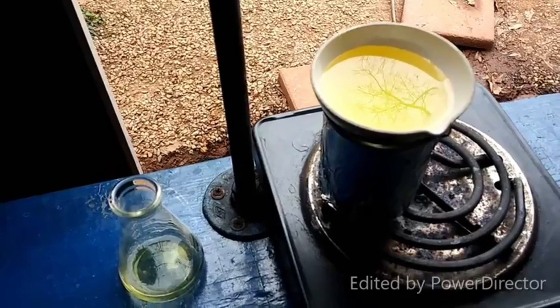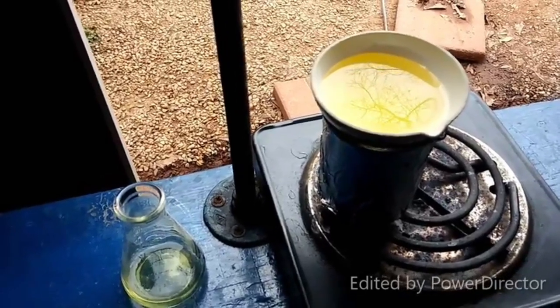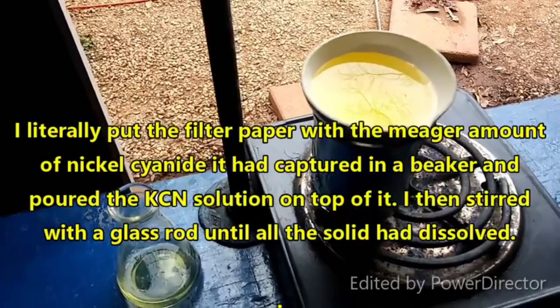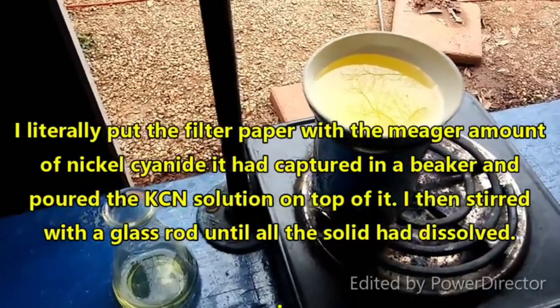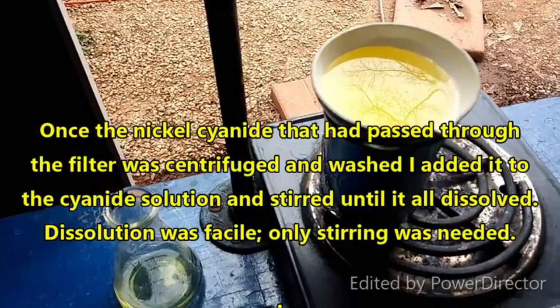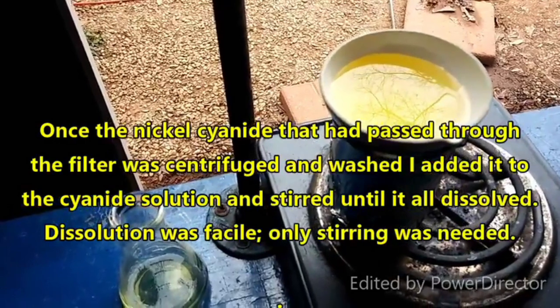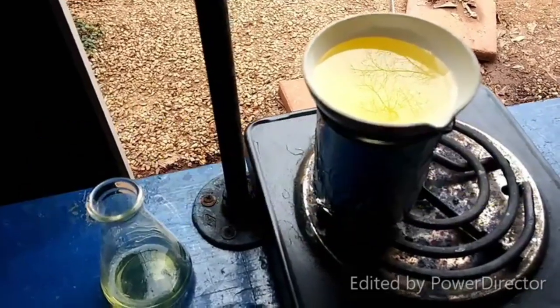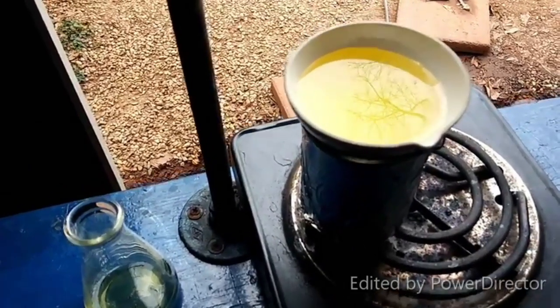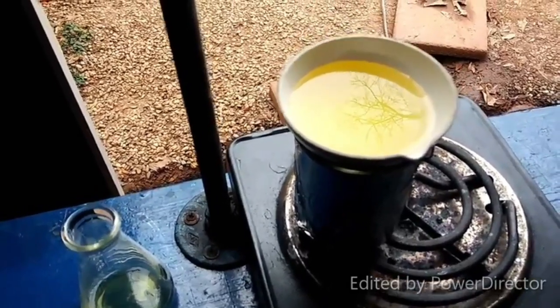What I was able to filter off, I put that into a beaker, and then I took all of the filtrate that was still totally full of nickel cyanide and ended up having to spin that down in the centrifuge in order to isolate it all and get rid of the filtrate from the initial reaction. So I removed all the other products of the reaction, transferred that nickel cyanide into the beaker, added the other gram of potassium cyanide, stirred it around, filtered that solution, and that gave me this.